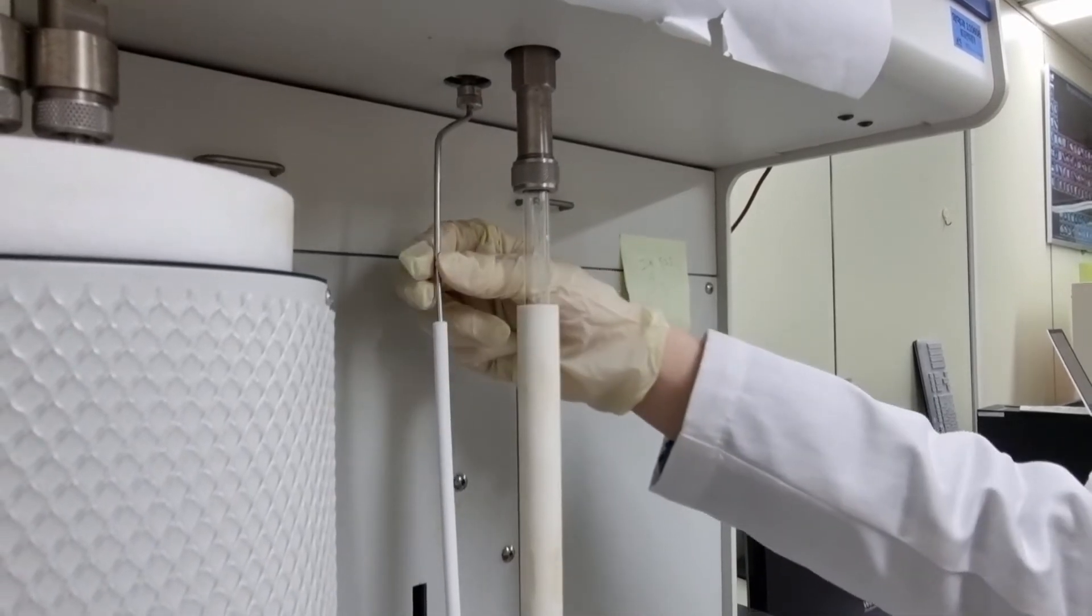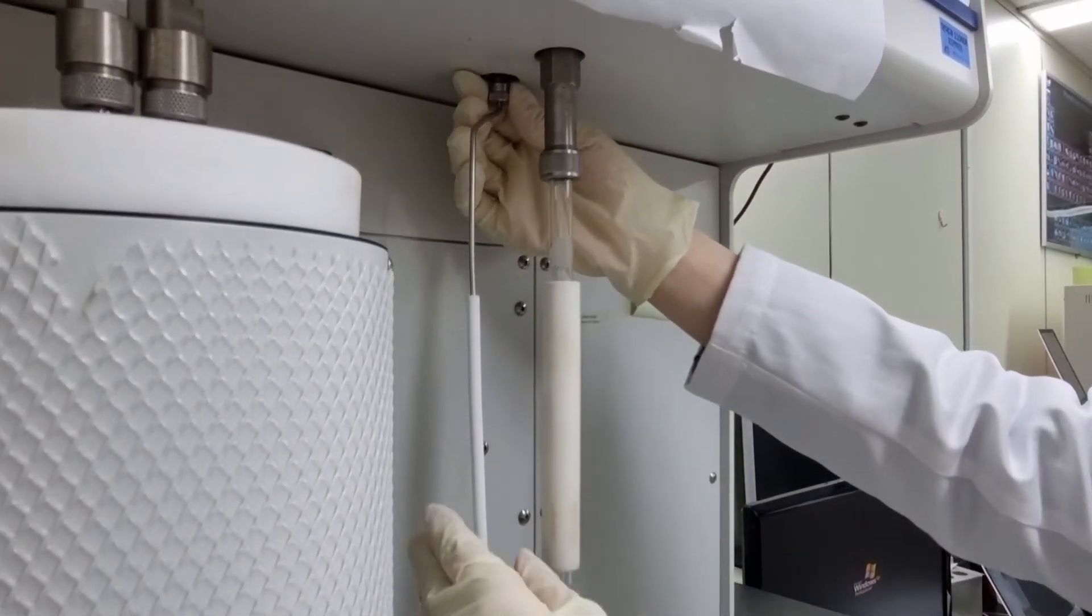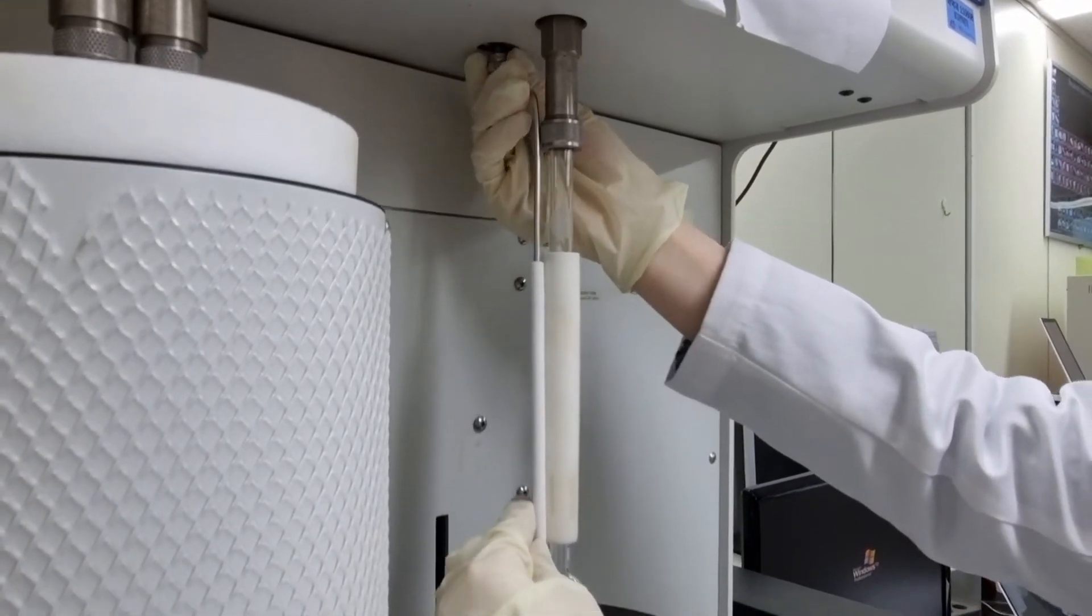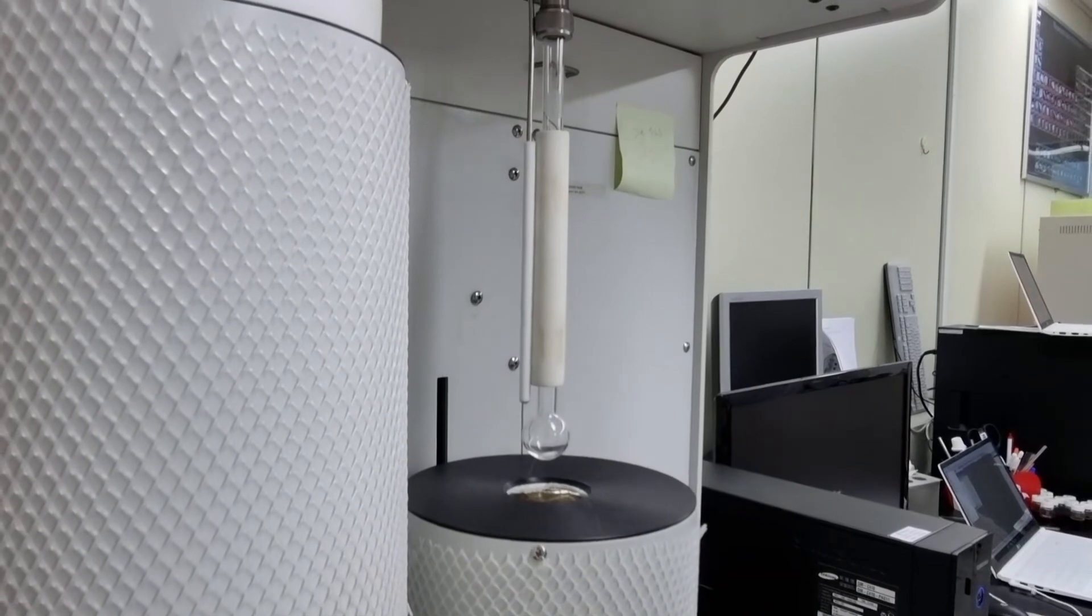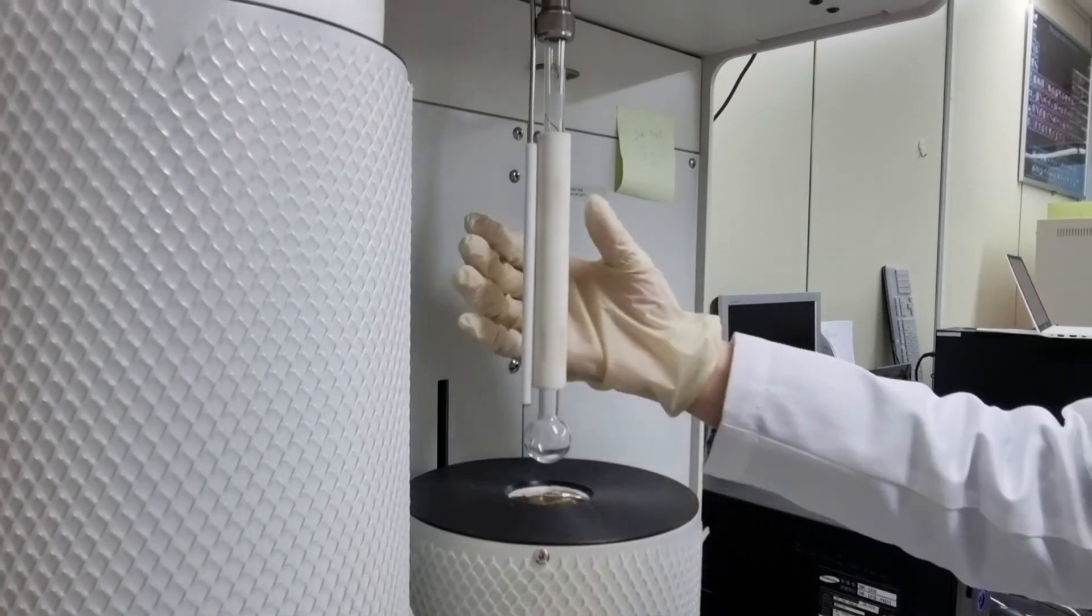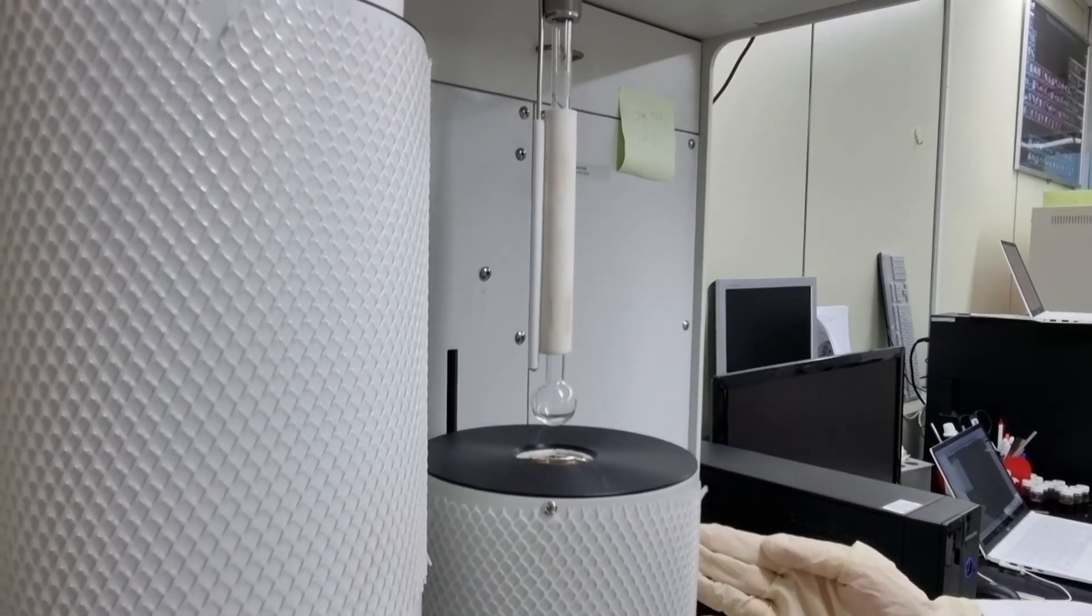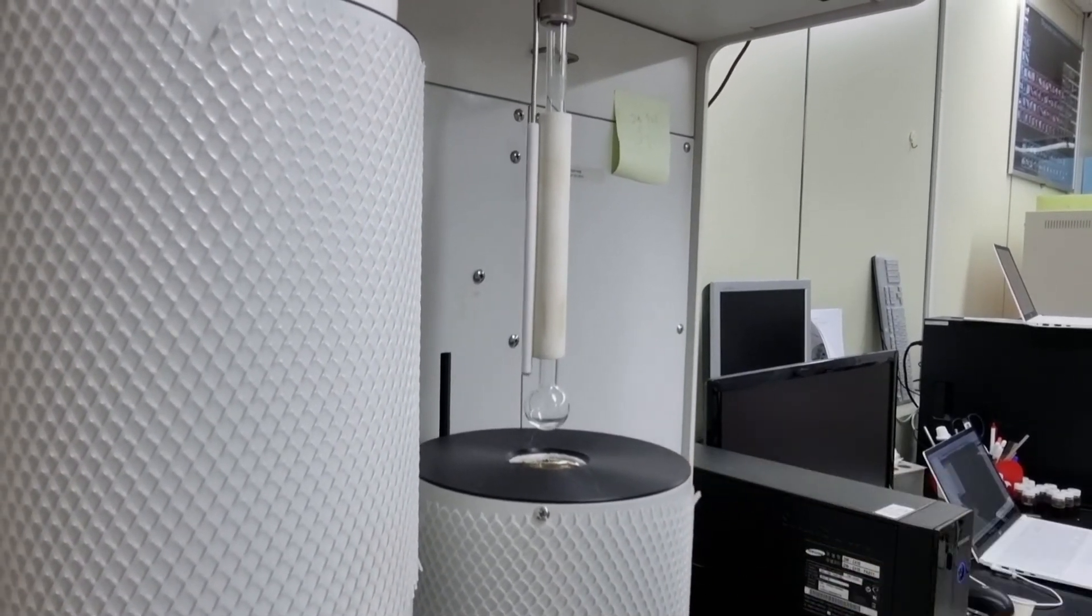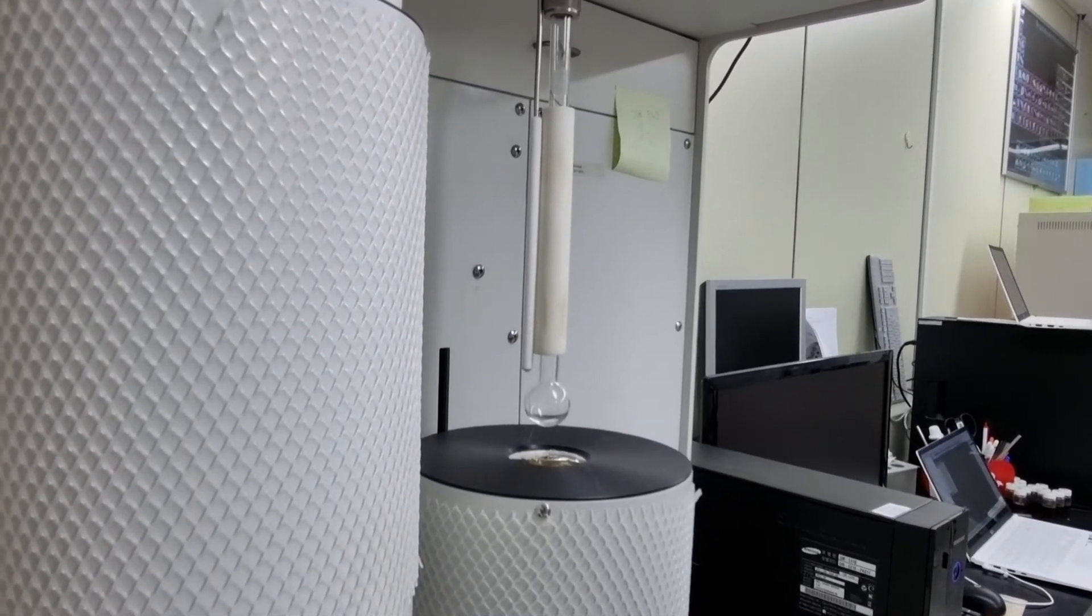Here is a pressure tube that measures the pressure, so you can move this close to the sample tube so that the dewar can go into both of the tubes. In the dewar, you should put liquid nitrogen to make the analysis run at 77 Kelvin degrees.